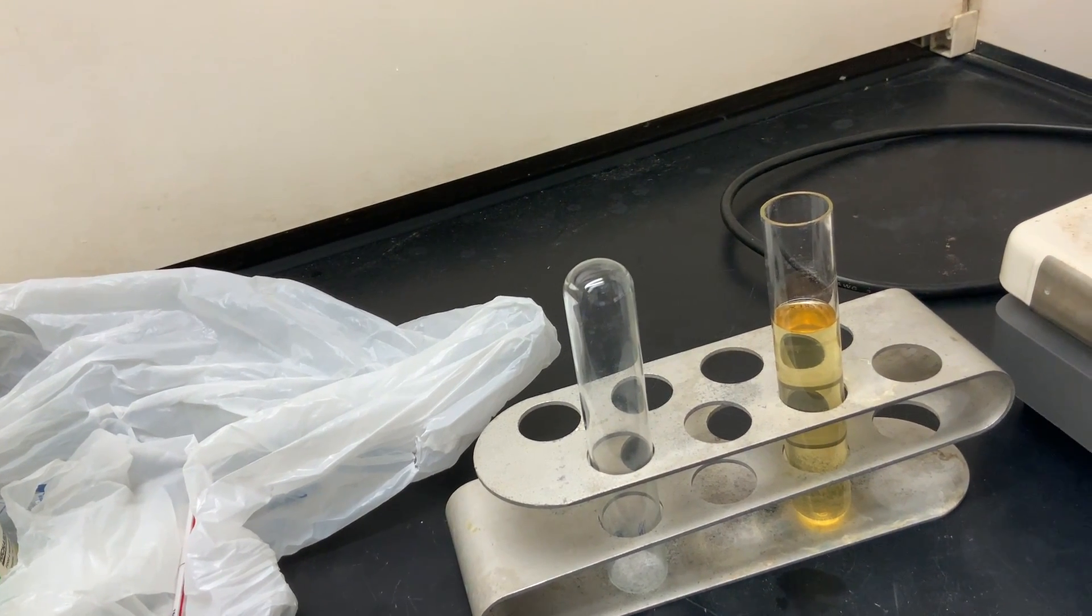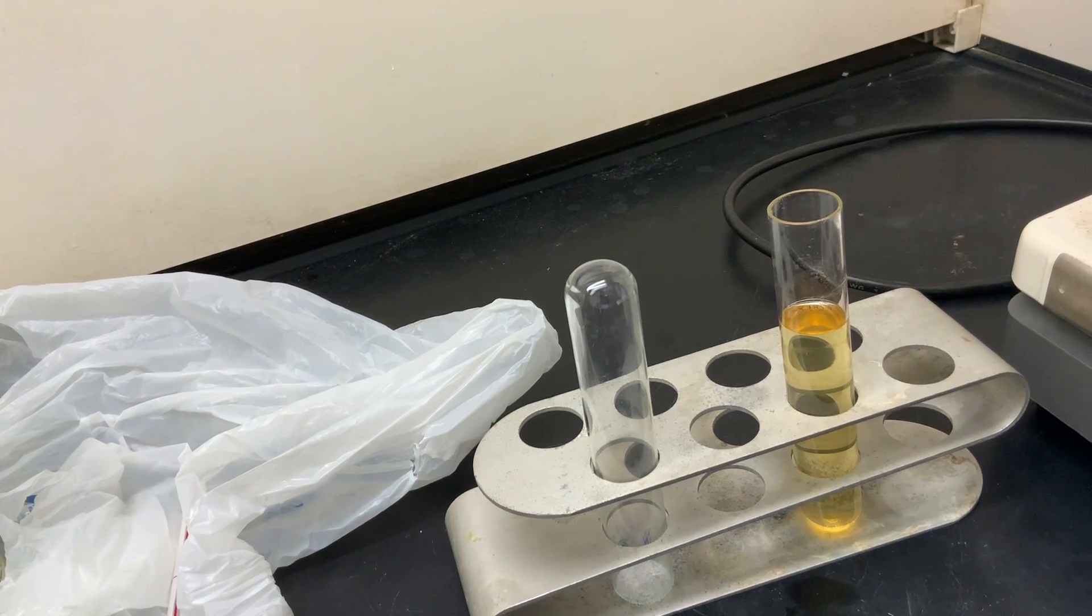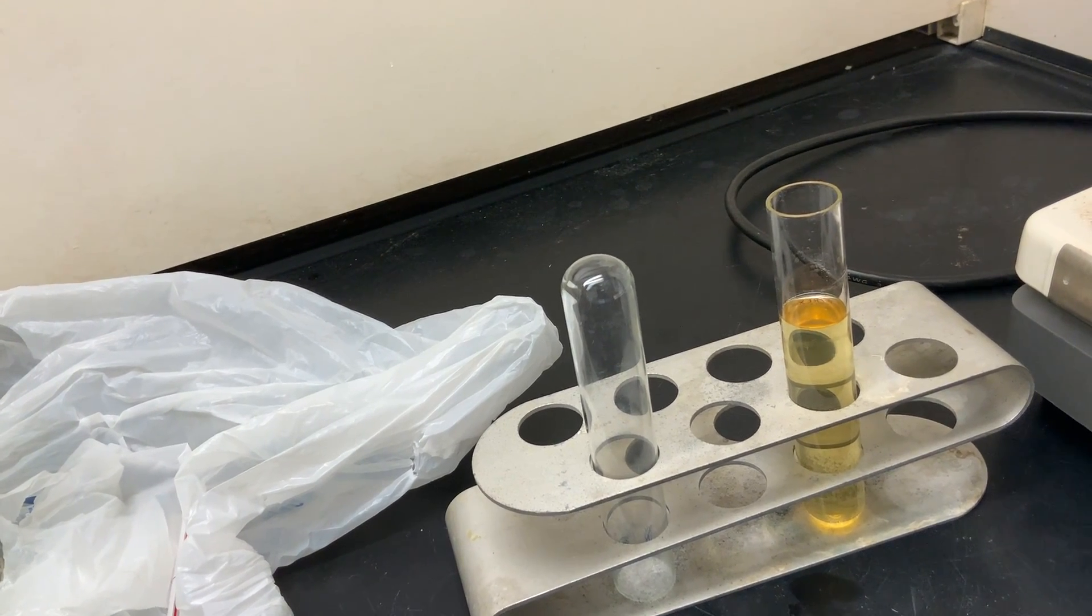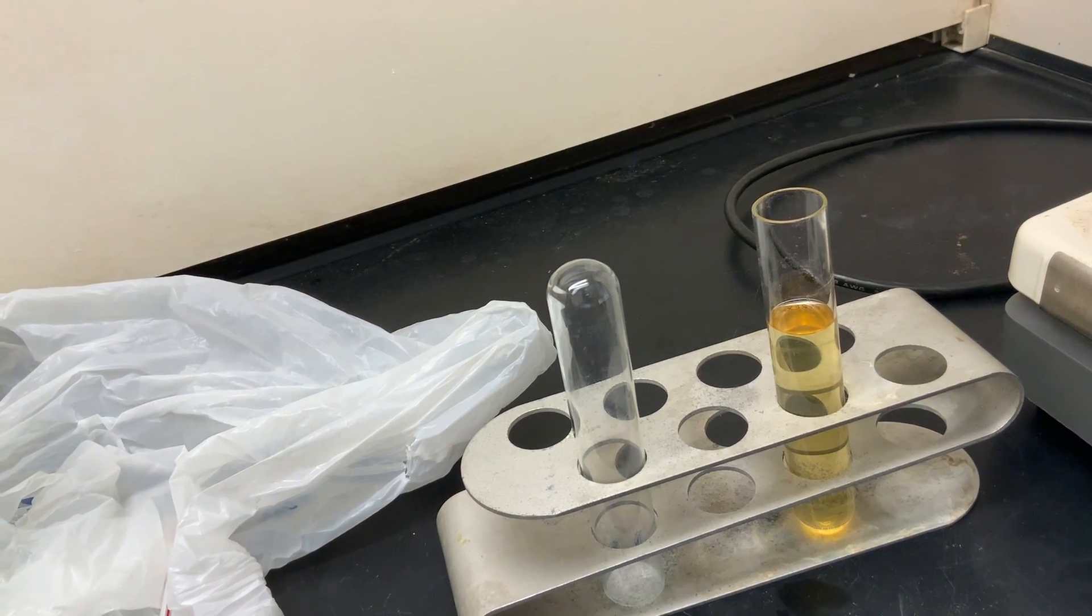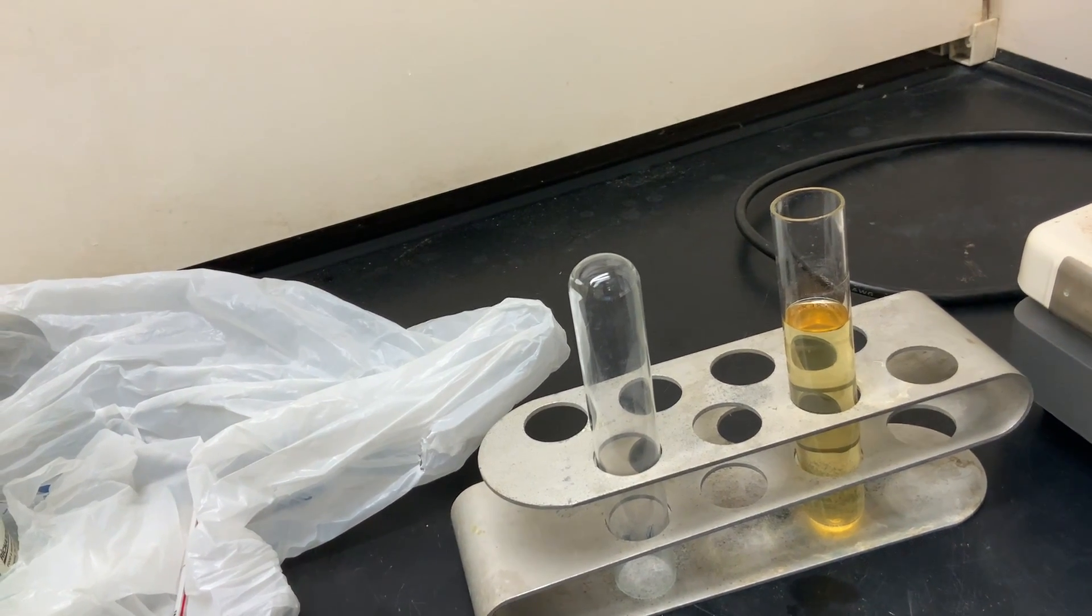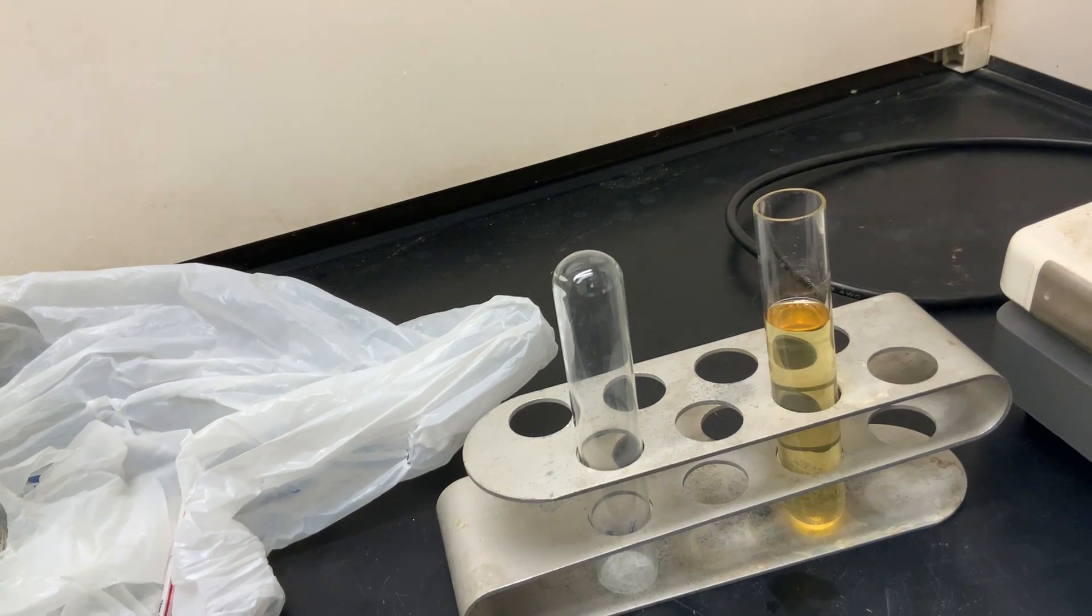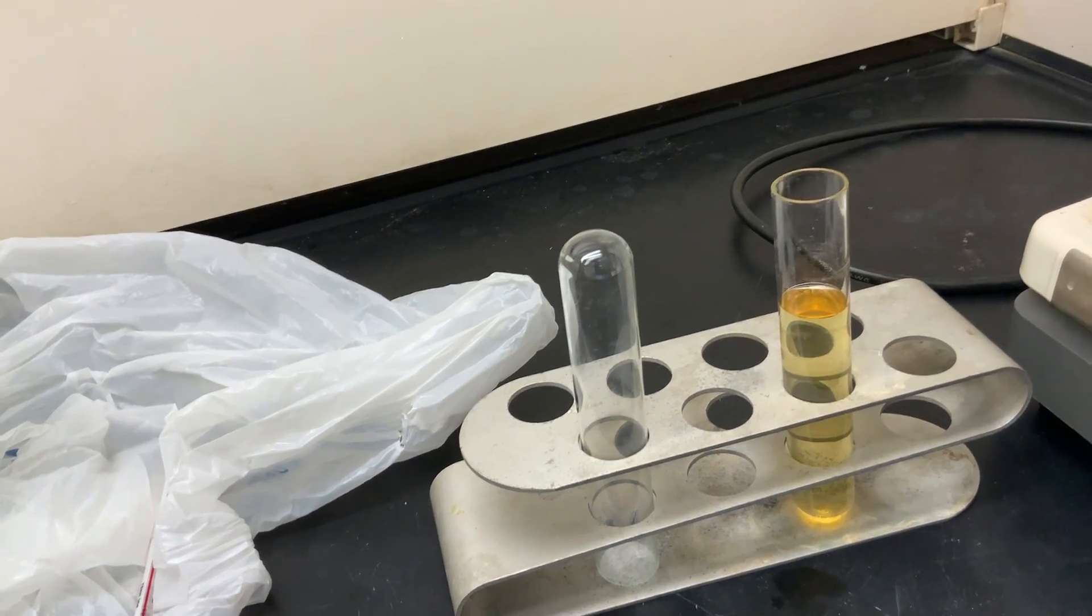The two components will be glycerol and our synthesized biodiesel. So the question is: which layer is the biodiesel? Is the biodiesel the top layer or is it the bottom layer?